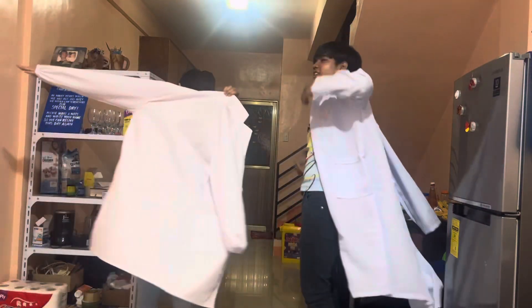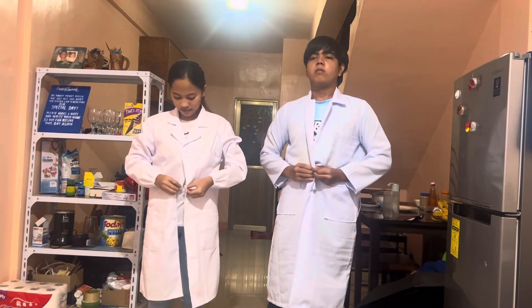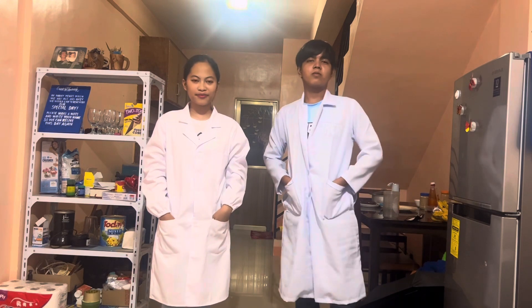Hello everyone, I am Yuri Hartvilias, and I'm Kiro Iyan Yamauchi from BS Bio 1D. And for today's video, we're going to do a toad dissection.